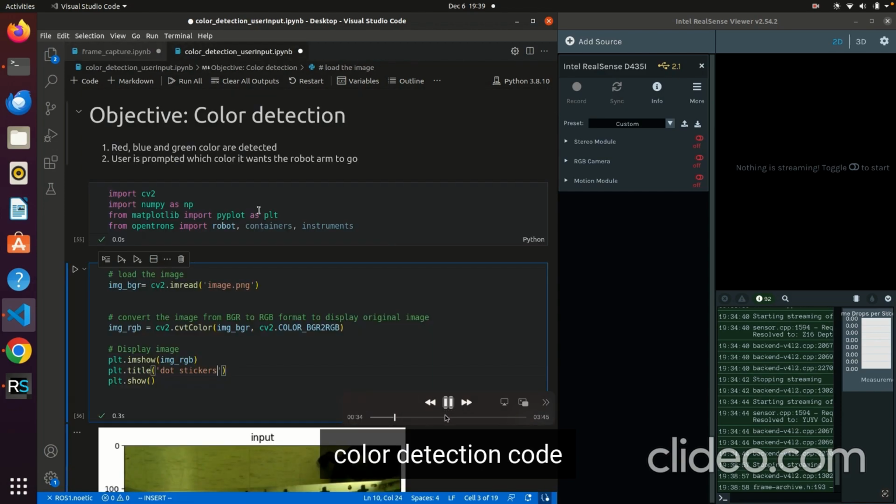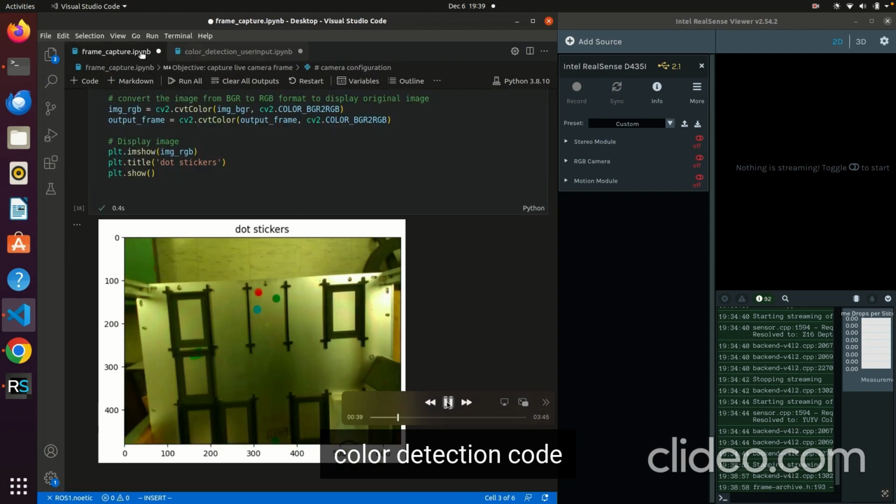In this video, I'm gonna go over the demo of my final project, line by line of code. So to start off, I'm gonna capture the live frame from my Intel depth camera. And in this script, I'm getting the live frames, and I'm going to import them into my color detection script.